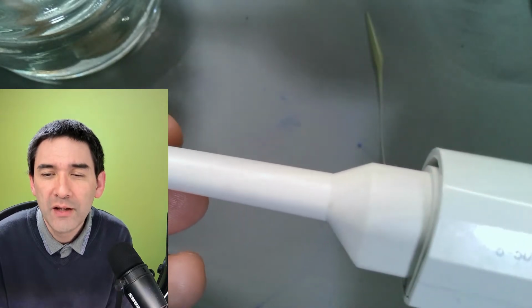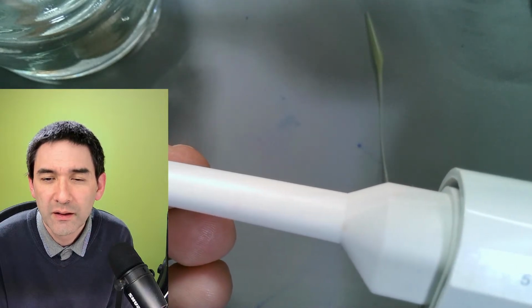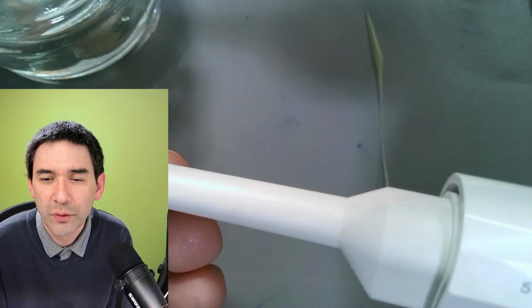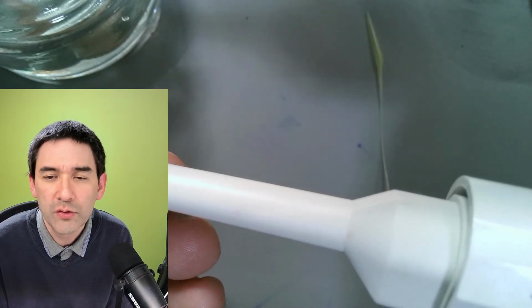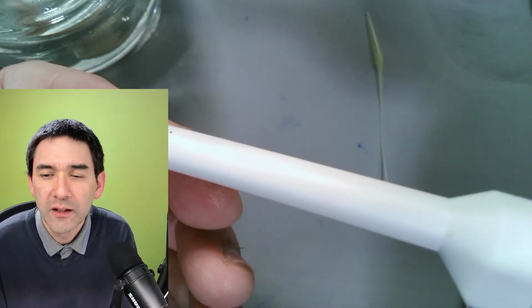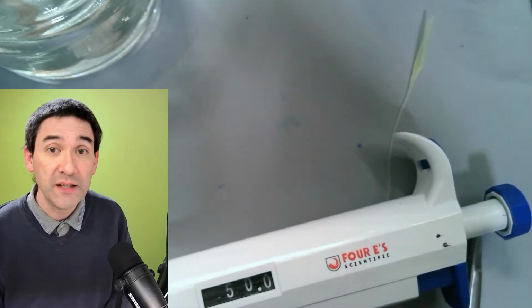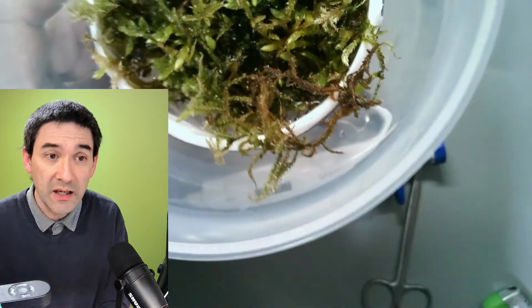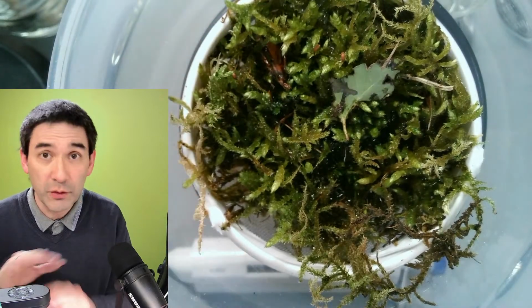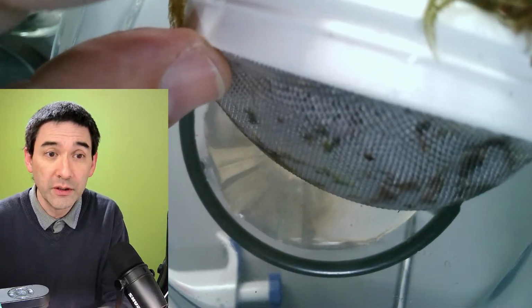I used the Baermann funnel for filtering seawater and sea sand for detection of diatoms, and it works well. Okay, interesting. Baermann funnel for filtering seawater. Can you tell us what sieve size you're using? Okay, the sieve size, I don't know. This is just a regular kitchen sieve that I'm using here. And I don't know the diameter of this. This is a very coarse one, right? So this is not a fine meshed one. This is actually pretty large, as you can see here.